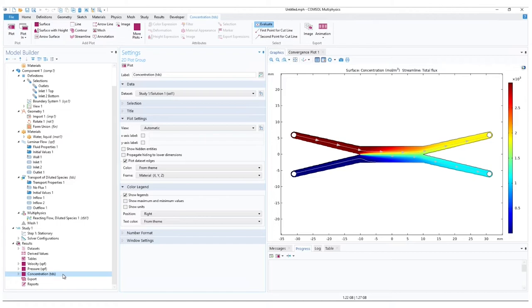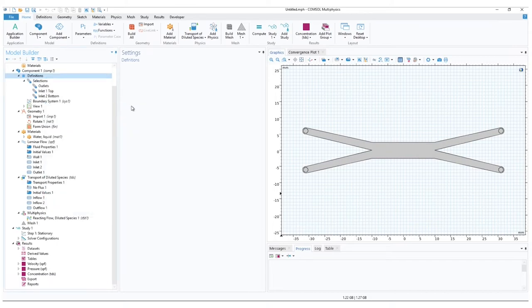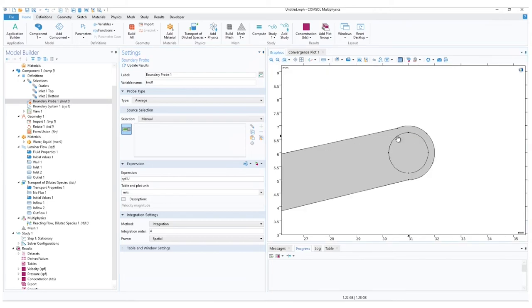In the Model Builder ribbon under Component 1, right-click on Definitions, go to Probes, and add a boundary probe. By default, we have all our boundaries selected. Clear the selection. And let us select one of the outlets. Zoom in and select.